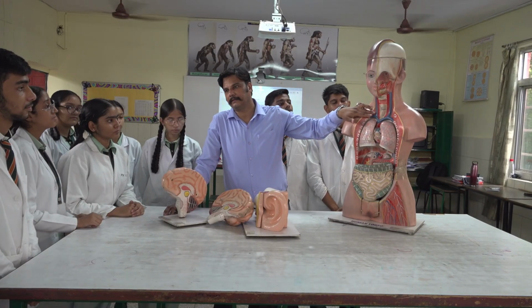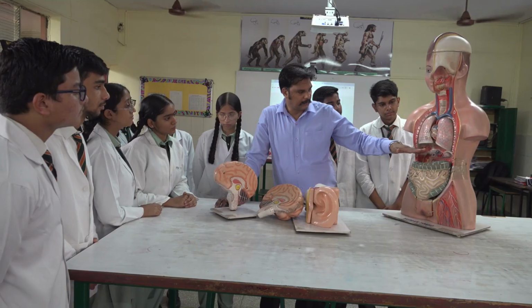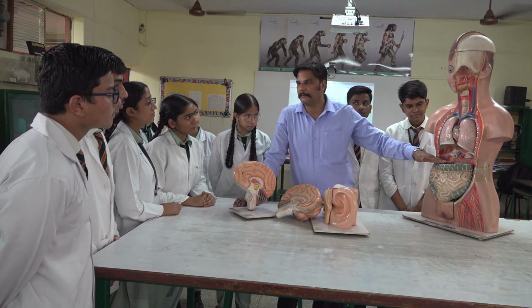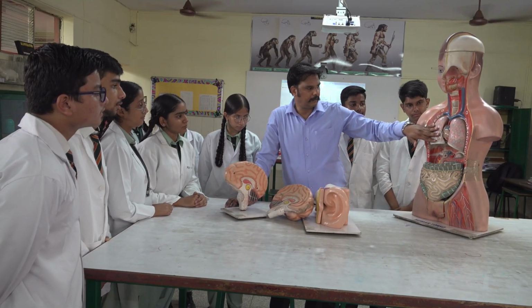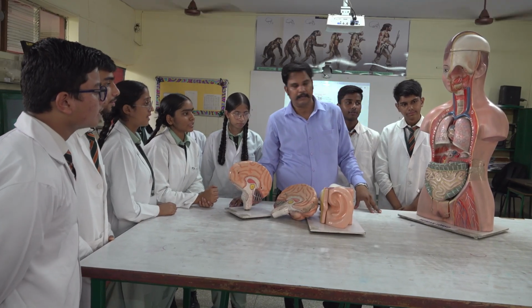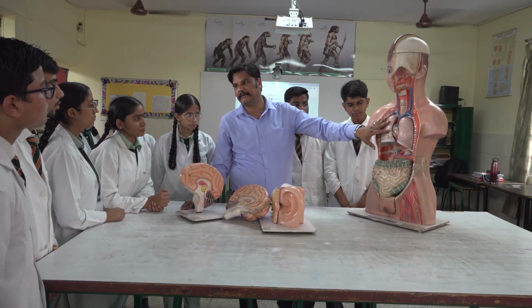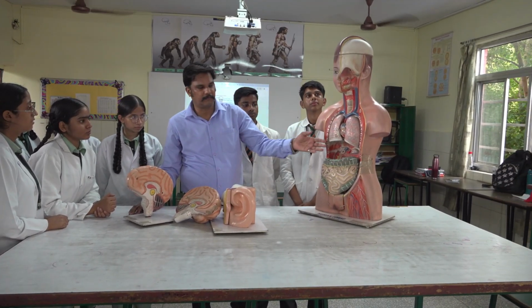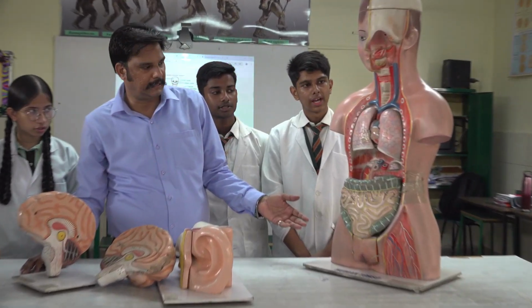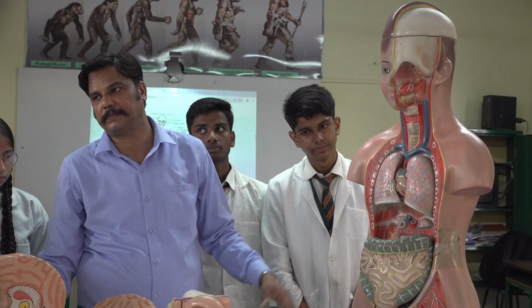Artery or vein? Vein, right? So these are lungs. The cavity below this is abdominal cavity. The cavity which occupies where the lungs are present is thoracic cavity. The change in the pressure inside the thoracic cavity is actually responsible for inhalation and exhalation. The rib muscles will contract or relax when the inhalation takes place.